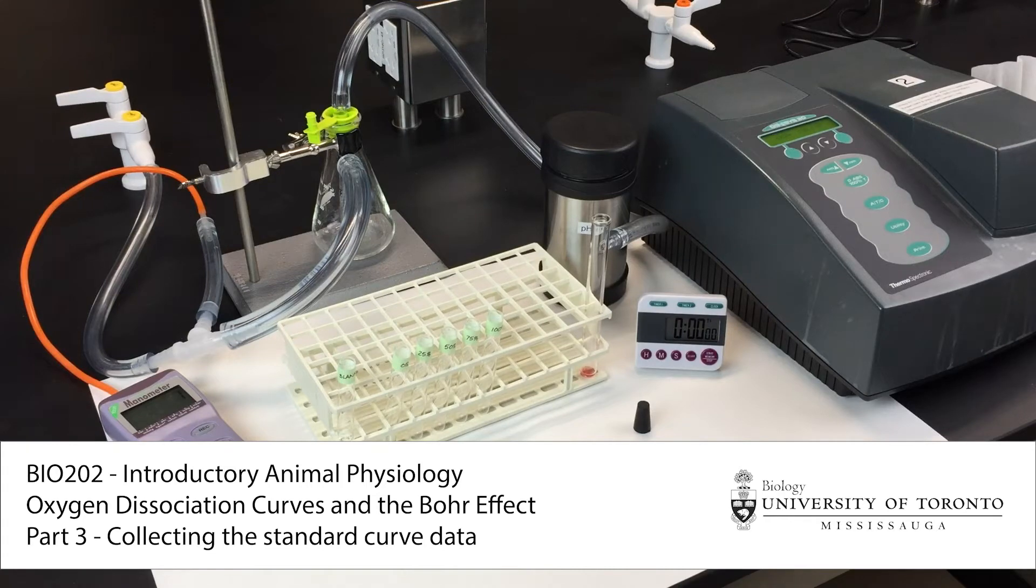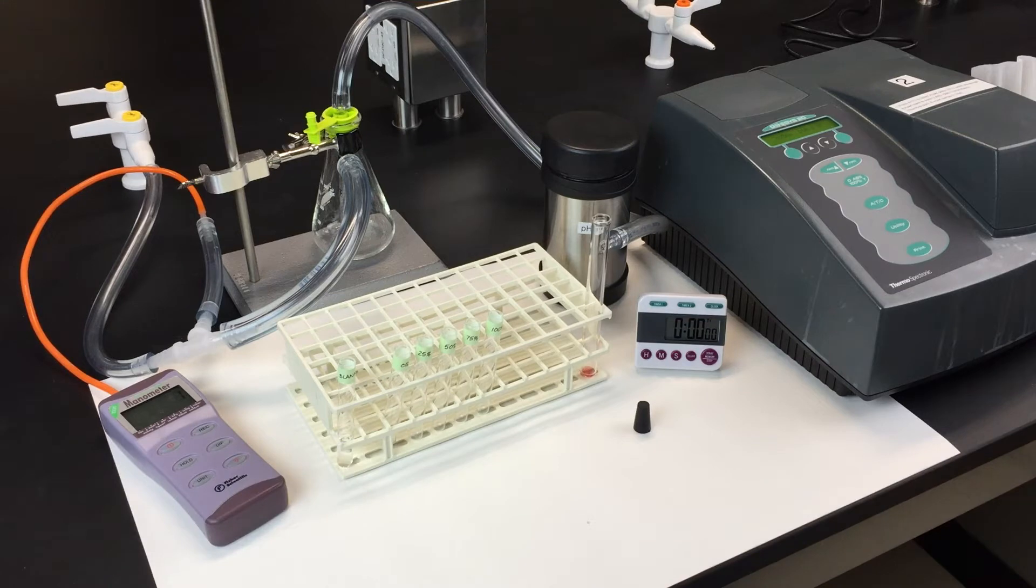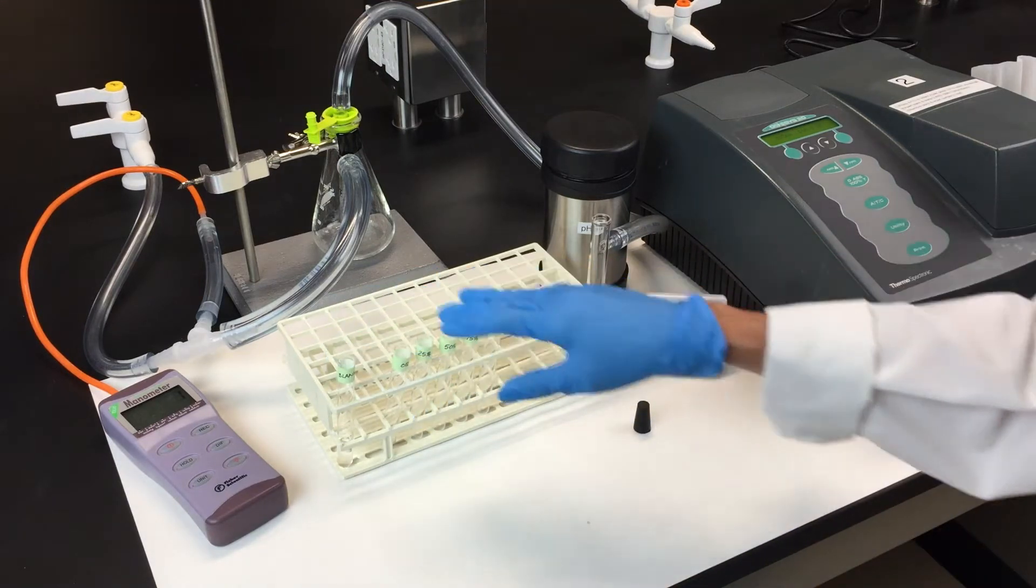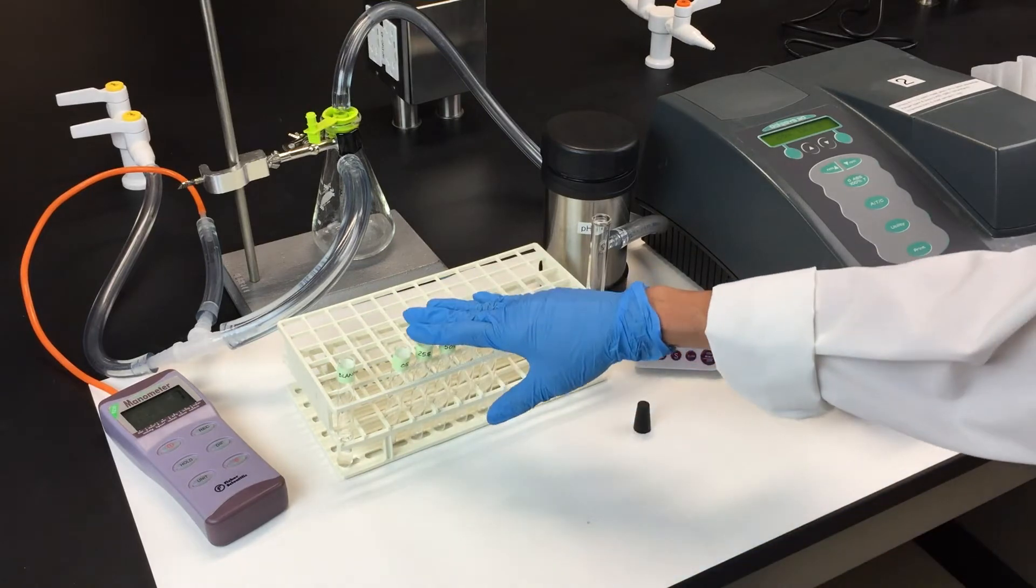The standard curve data is provided for you, but you should understand how it's collected. Start by labeling a tube for the blank and a series of five test tubes, one for each point on your curve.